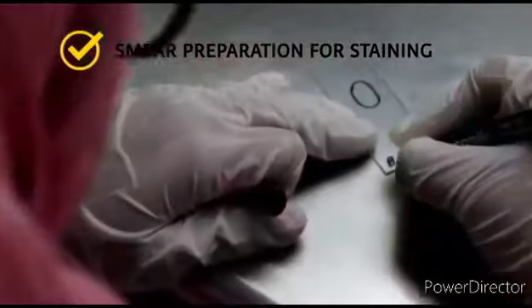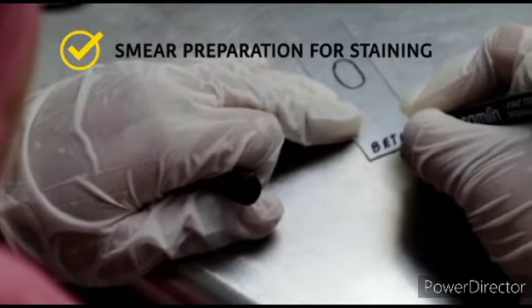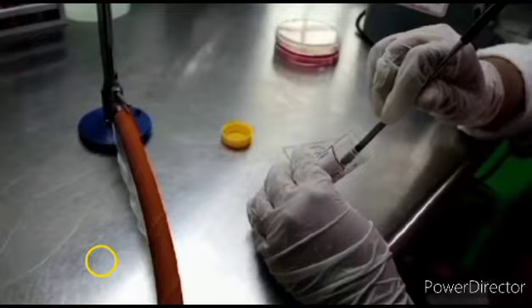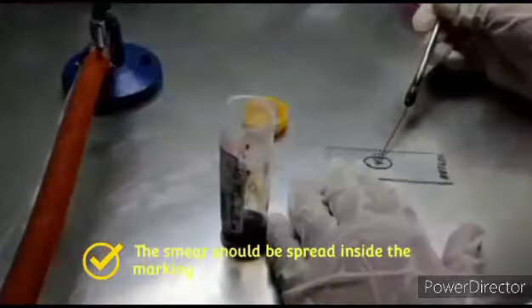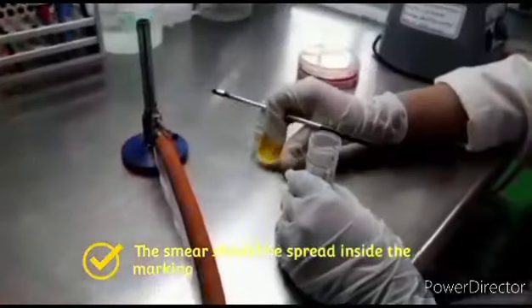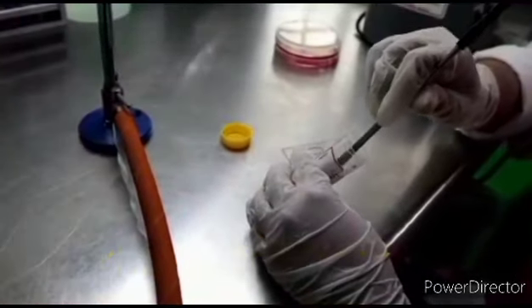Then the slide is marked with the lab ID number for the primary diagnostic process, that is Gram staining. A half-loop of sample is spread in the marked area of the slide. The smear should be neither too thick nor too thin. Then the slide is heat fixed for the further process.